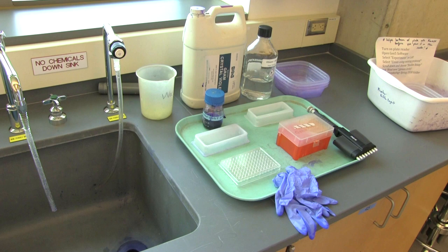This video will show you how to process your biofilms. It will cover three main steps.